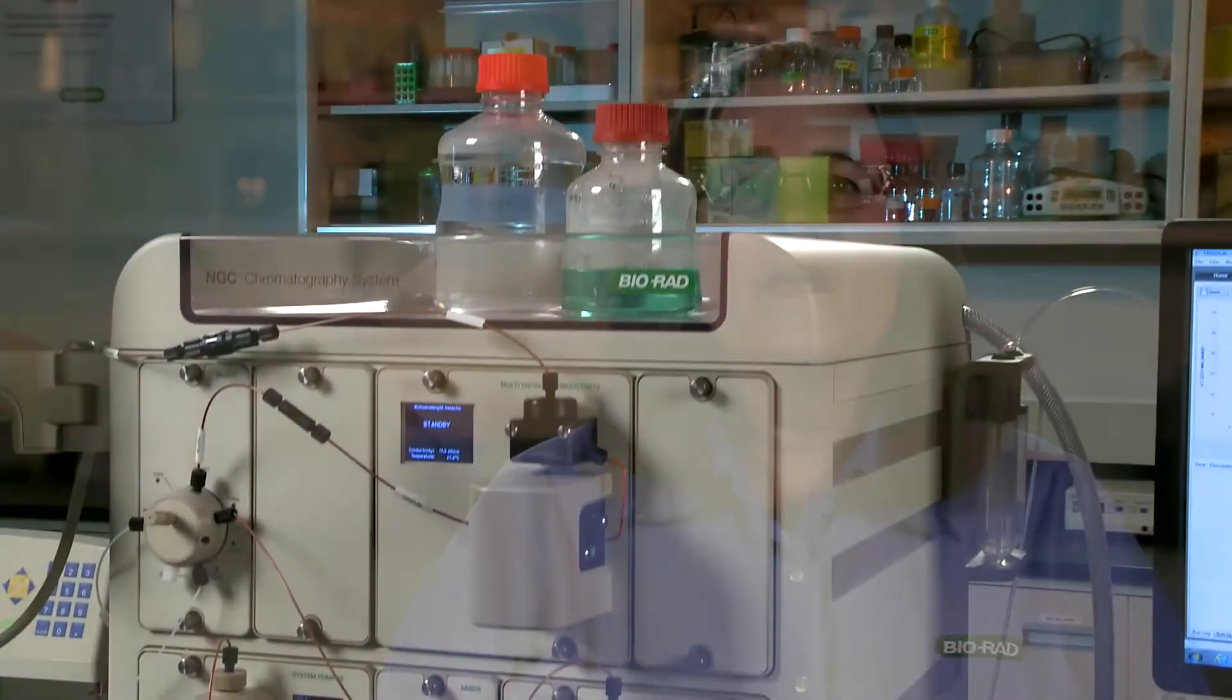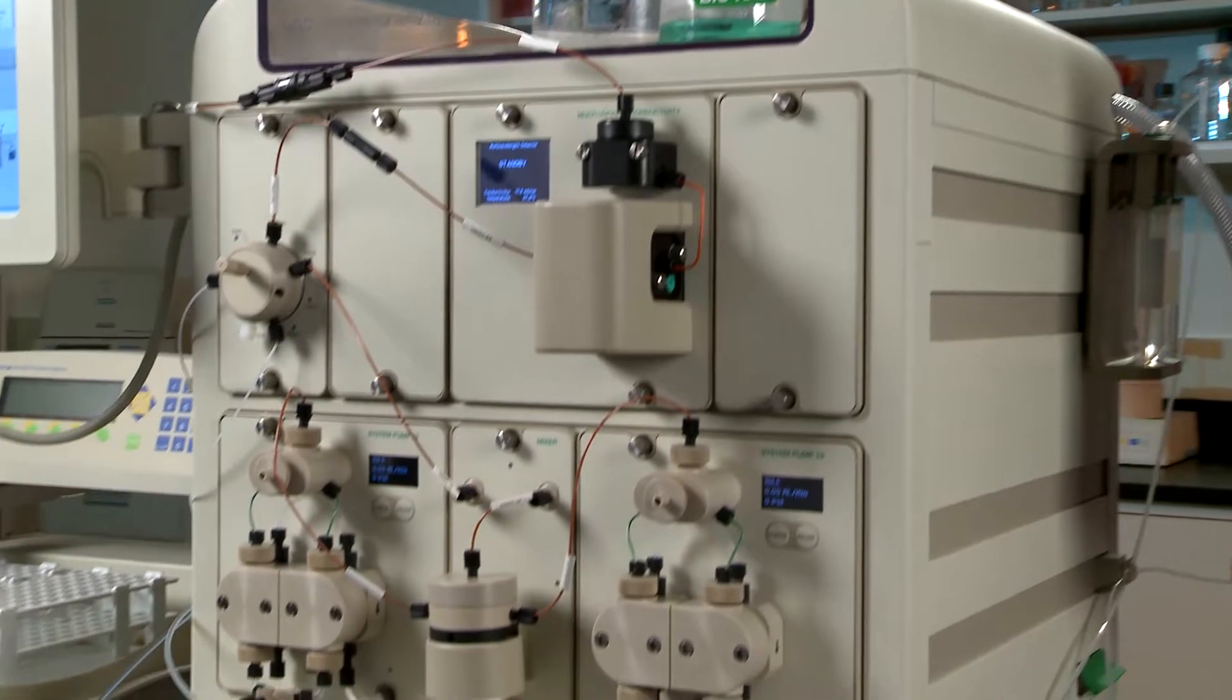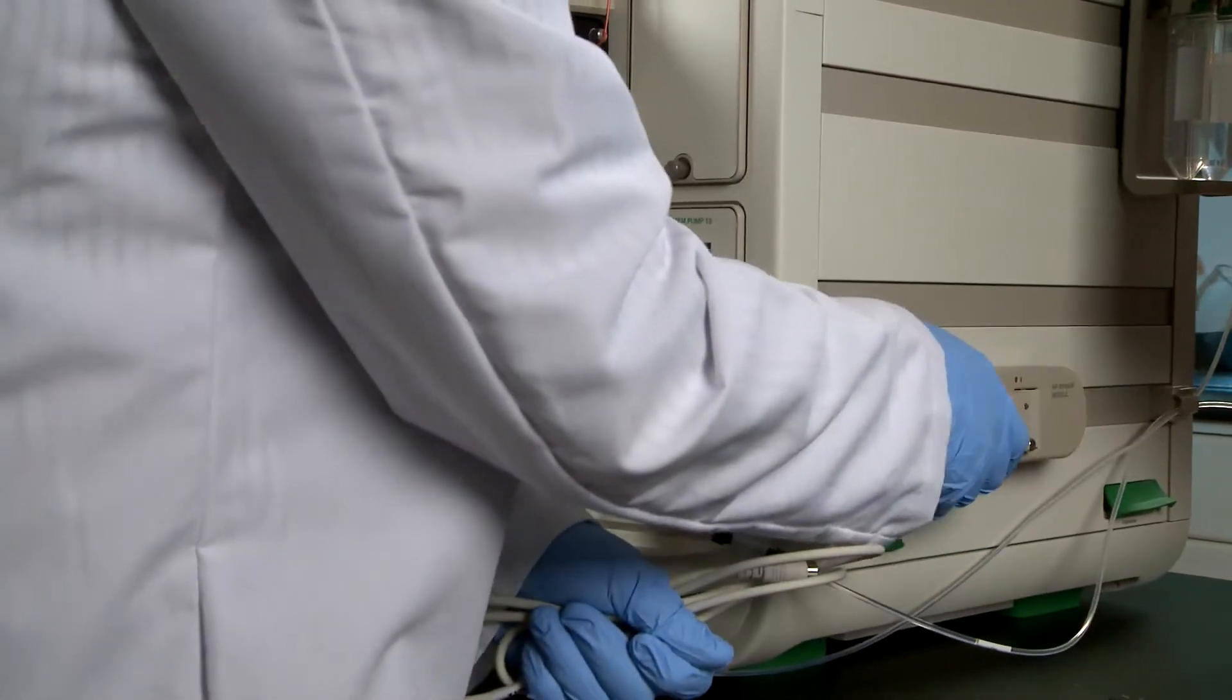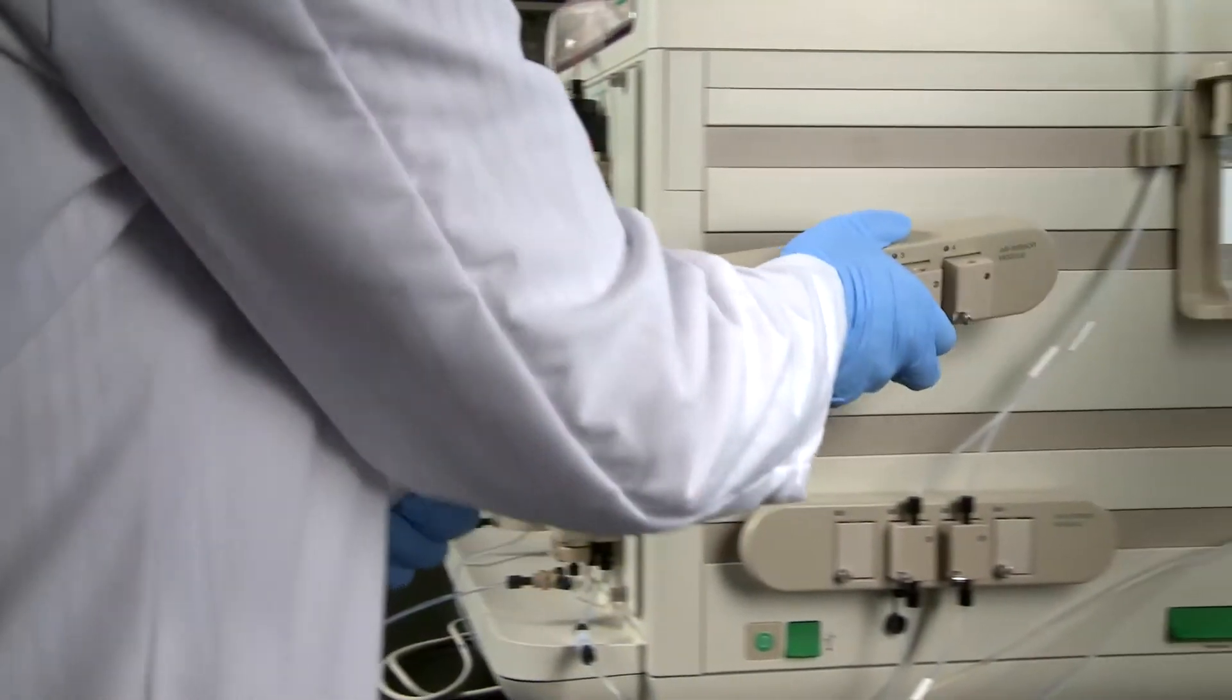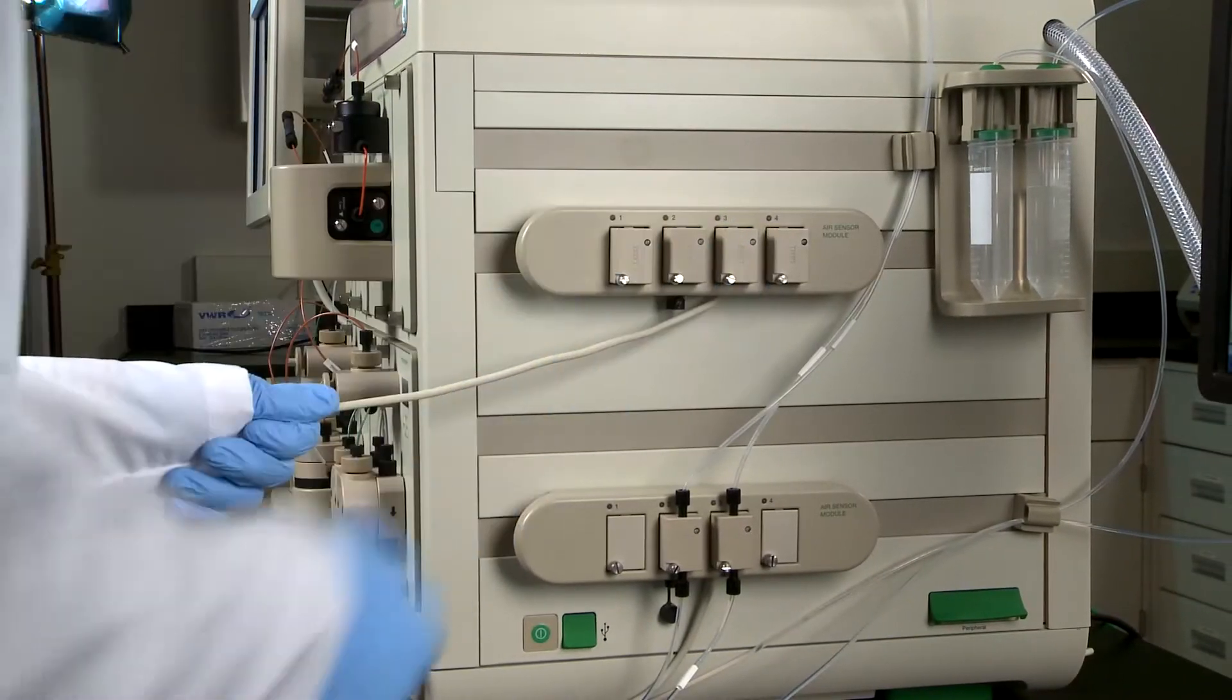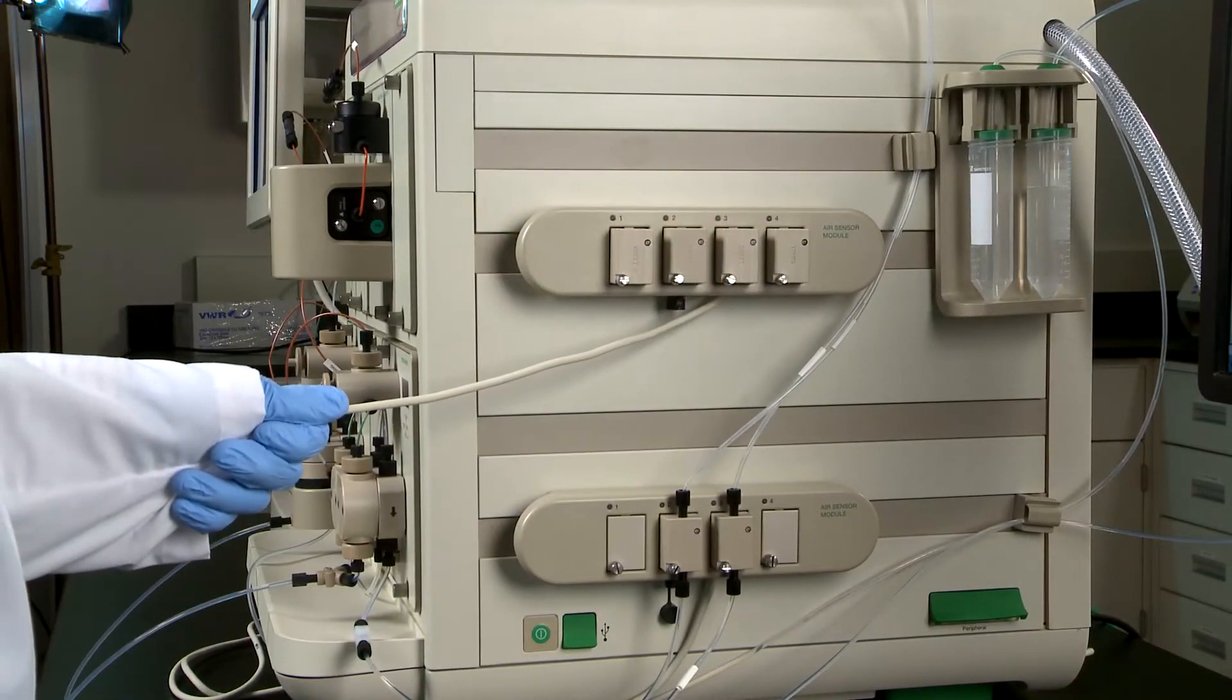Installing an air sensor module can save you time and valuable resources. The NGC air sensor module can support up to four air sensors. Add an air sensor expansion module and you can increase capacity to as many as eight air sensors.